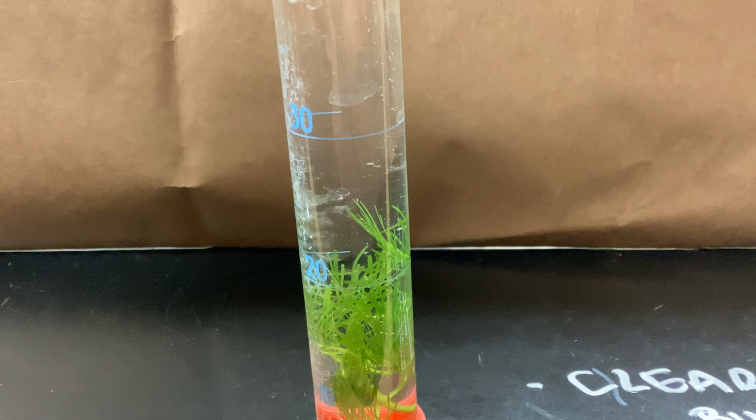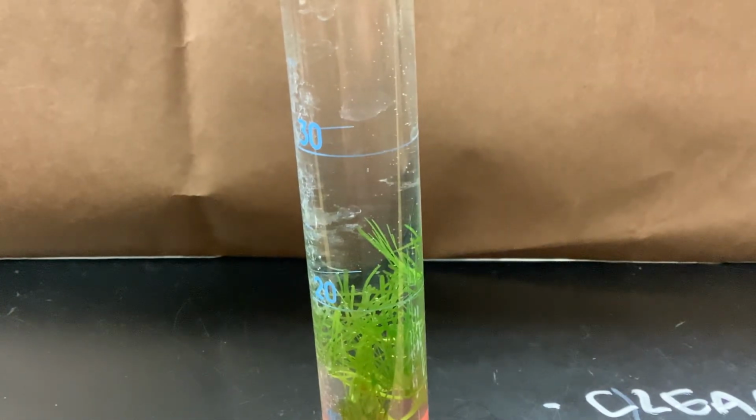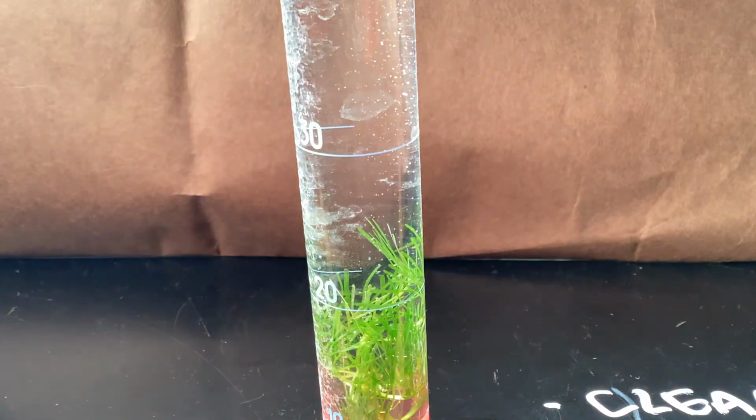We'll start it up at minute 5. And again, every time you see a bubble pass that blue line, you can go ahead and register that as a bubble, as some oxygen being made. So we'll count down from 55, 56, 57, 58, 59. All right, start counting. Light is on. 1, 2, 3, 4, 5.